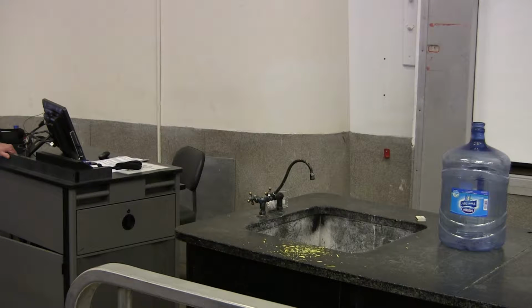So, I got a whole lot of liquid nitrogen here, folks, so I'm going to pour it into this vessel here, and we can experiment with throwing different things in there and see what happens to their physical properties.